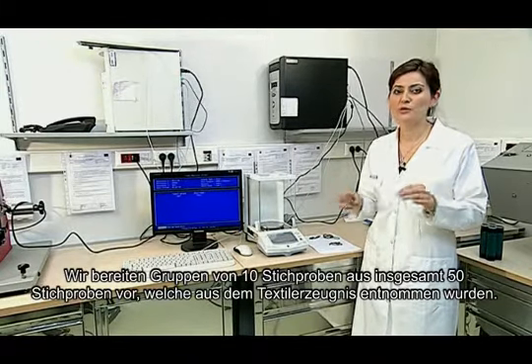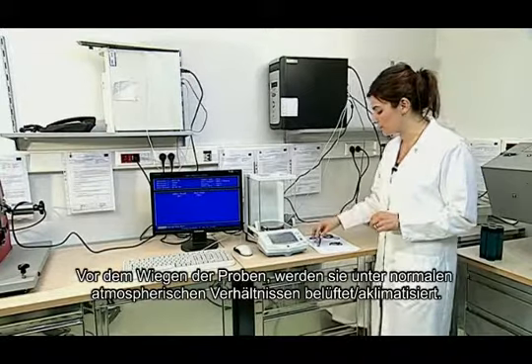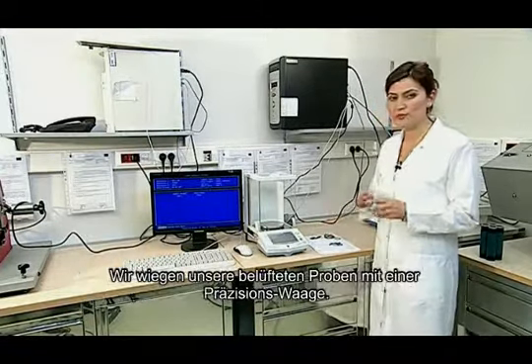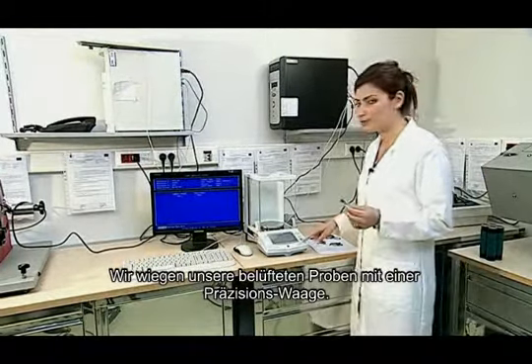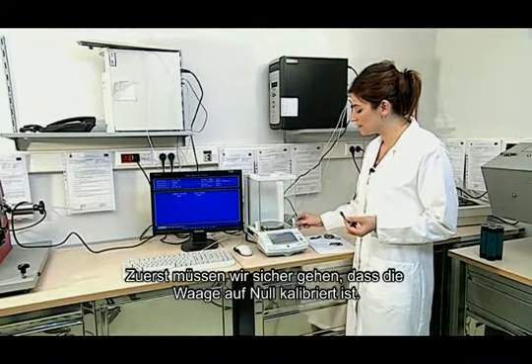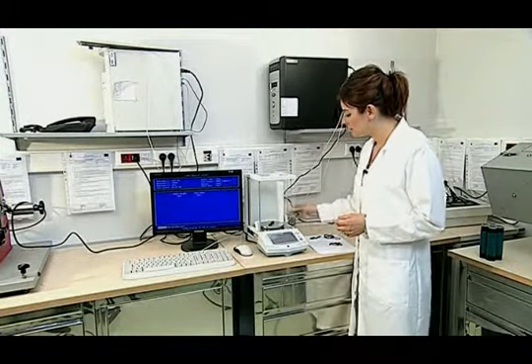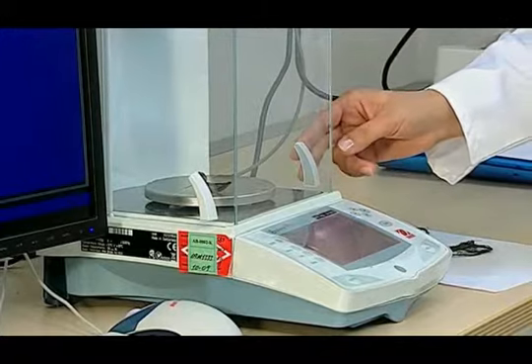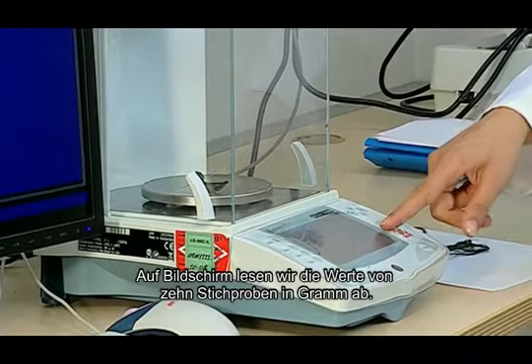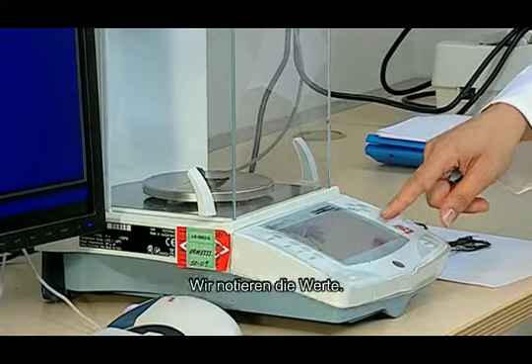We prepare groups of 10 samples from a total of 50 samples that have been taken out of the fabric. Before weighing our samples, we condition them in standard atmospheric conditions. We weigh our conditioned samples with the precise balance. Firstly, we ensure that the precise balance is at 0. On the screen, we read values for 10 samples in grams, and we record the values.